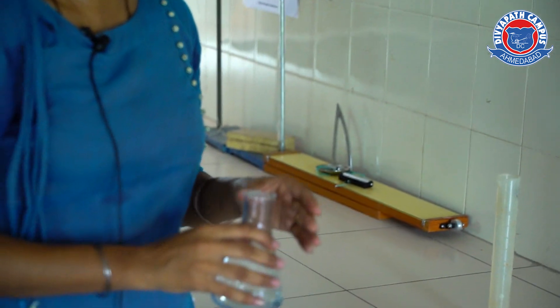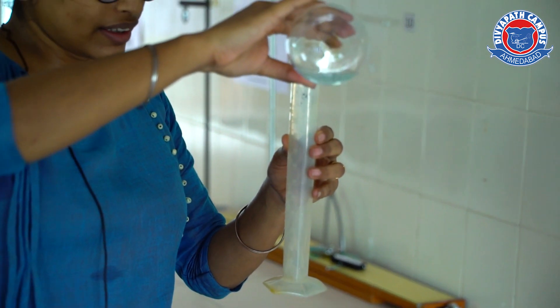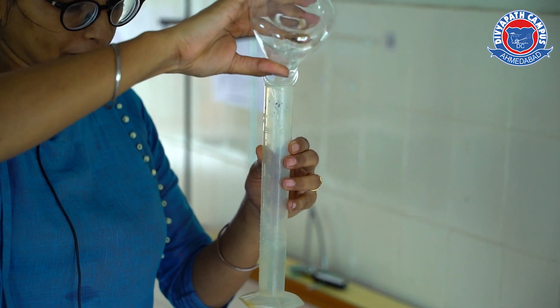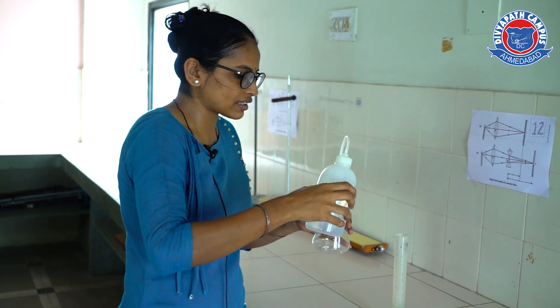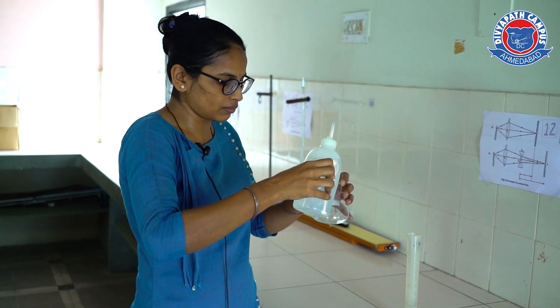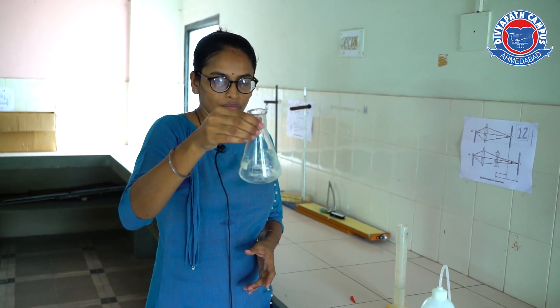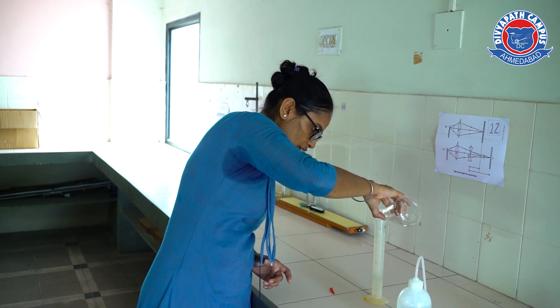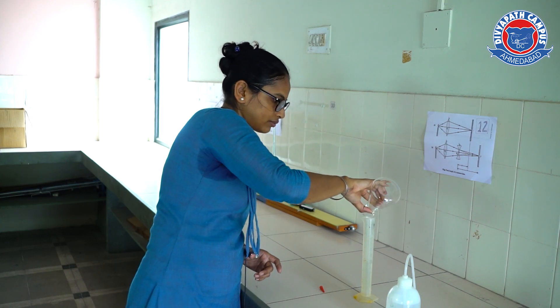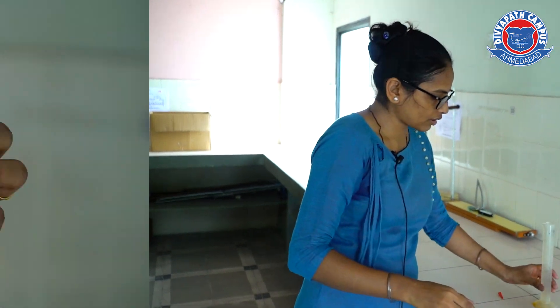For the exact measurement, we will take the measuring cylinder and transfer this solution inside the measuring cylinder. You can see some particles are attached on the flask, so we will wash the flask again with distilled water and transfer the solution inside the measuring cylinder again. Now you can see the flask is also clear.